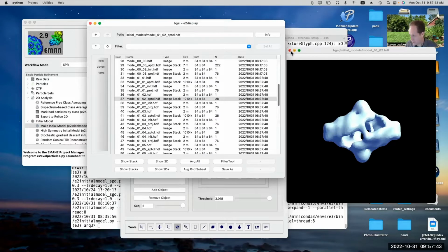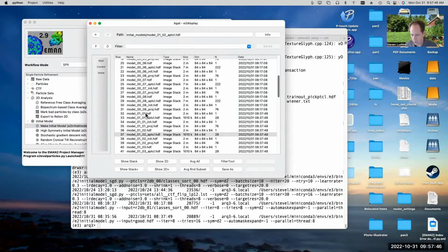Probably I didn't try it, but probably if I used this one that I didn't like as much as an initial model, it would probably still converge to the correct final 3D structure eventually. But not necessarily. You can come up with initial models which are all very self-consistent. So this one was very self-consistent. All the class averages and projections matched each other, which means that unless there's enough particles in those other orientations to kind of fix things, you could wind up in a situation where it'll just iterate and get stuck in that local minimum forever. So there are some gotchas you can run into here once you start doing the 3D refinement in theory.